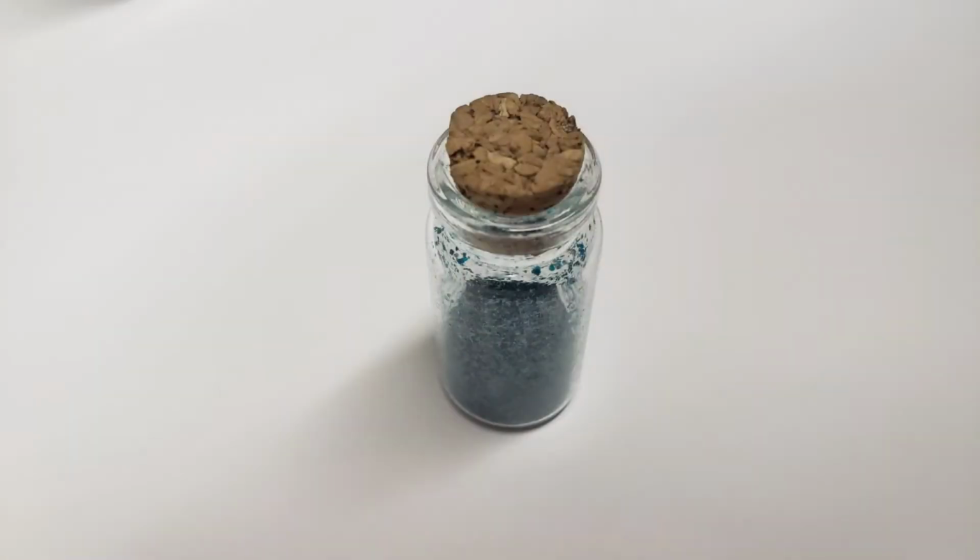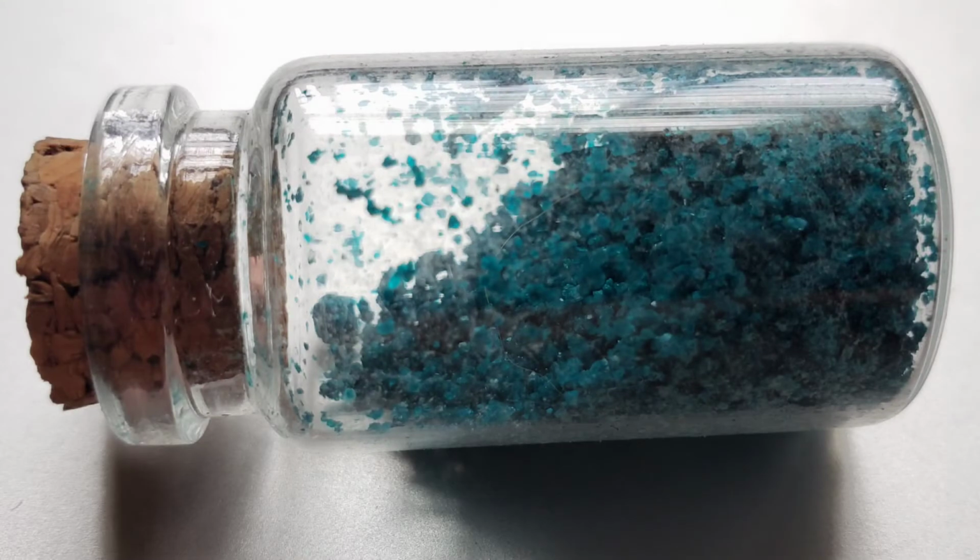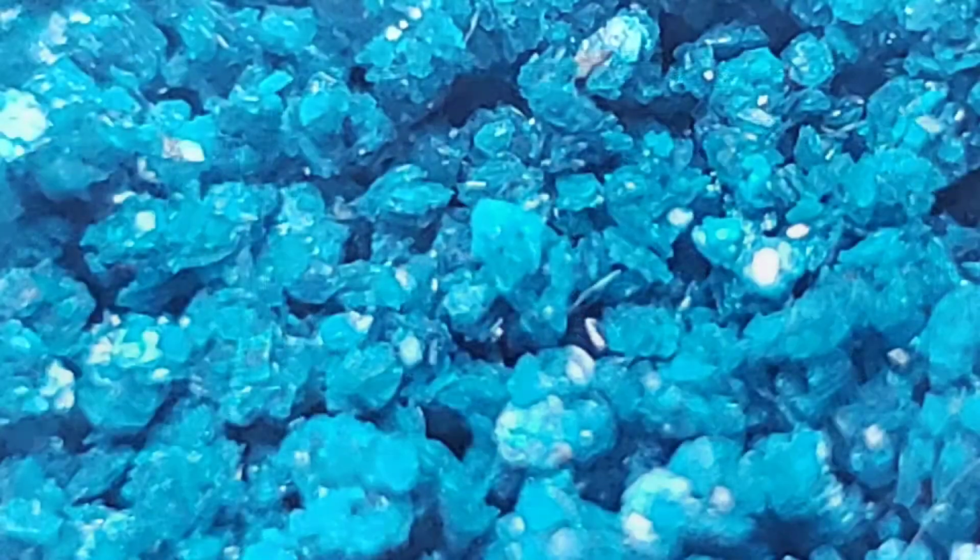And so I realized that I had been pretty dumb doing that, but I managed to scrape the remaining copper acetate off the bigger shards of glass and put it into a little bottle here, which I didn't accurately measure, but a rough estimation was about 30 mils. And why I haven't since accurately measured it was because I lost it.